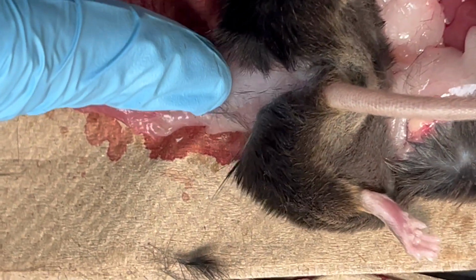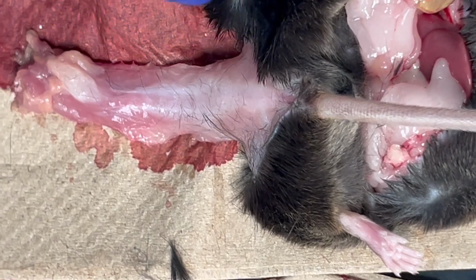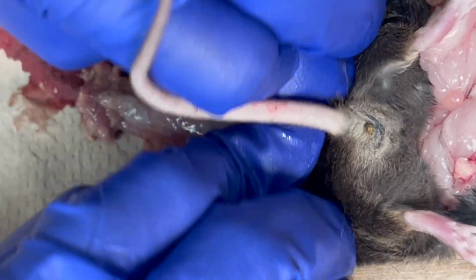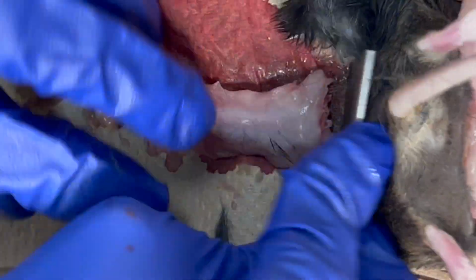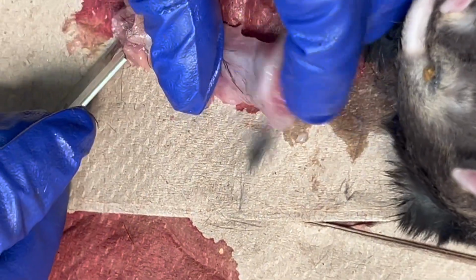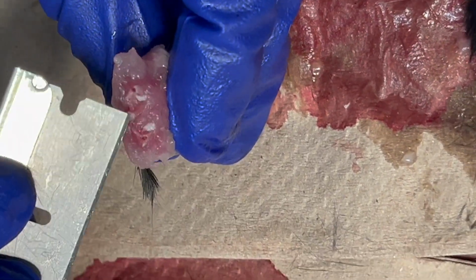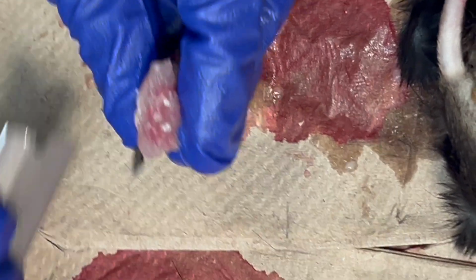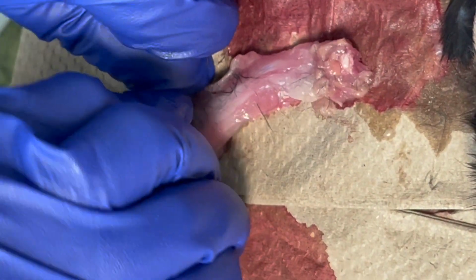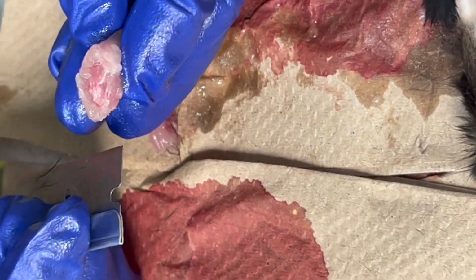Yeah, you can feel it, you just fold your fingers to feel the edge of the hip. So when I cut, I'm going to try going literally like this, equally, so that this cut is as clean as possible. But sometimes the spinal cord retracts, so right away, if you don't look, you're not going to see. Do you see the tiny bit, right here? This is the vertebra. So I will cut a little bit so that you guys can see this nicely. I'm going to cut just a little bit out, and then you will probably see it a little easier. So do you see now? It's right here.